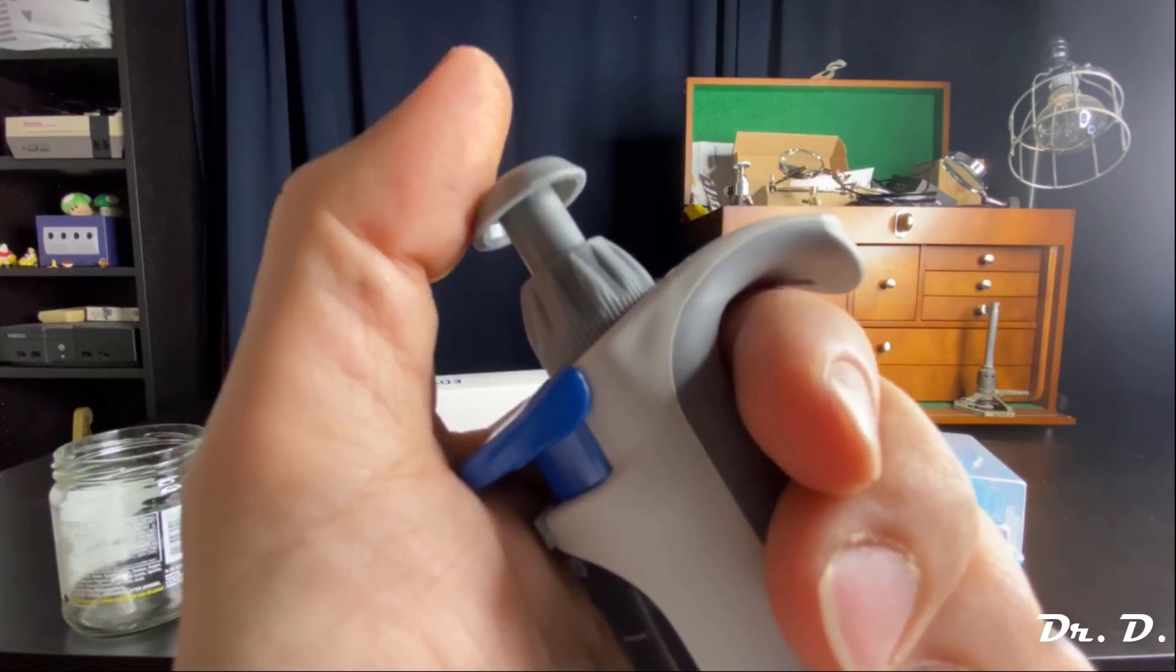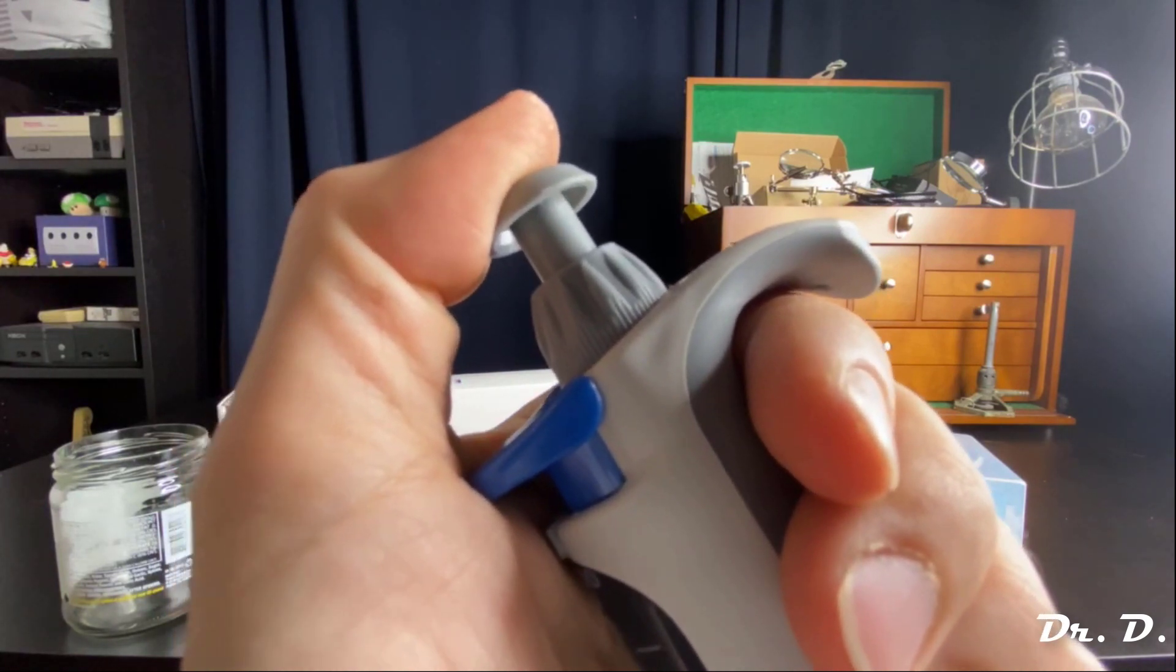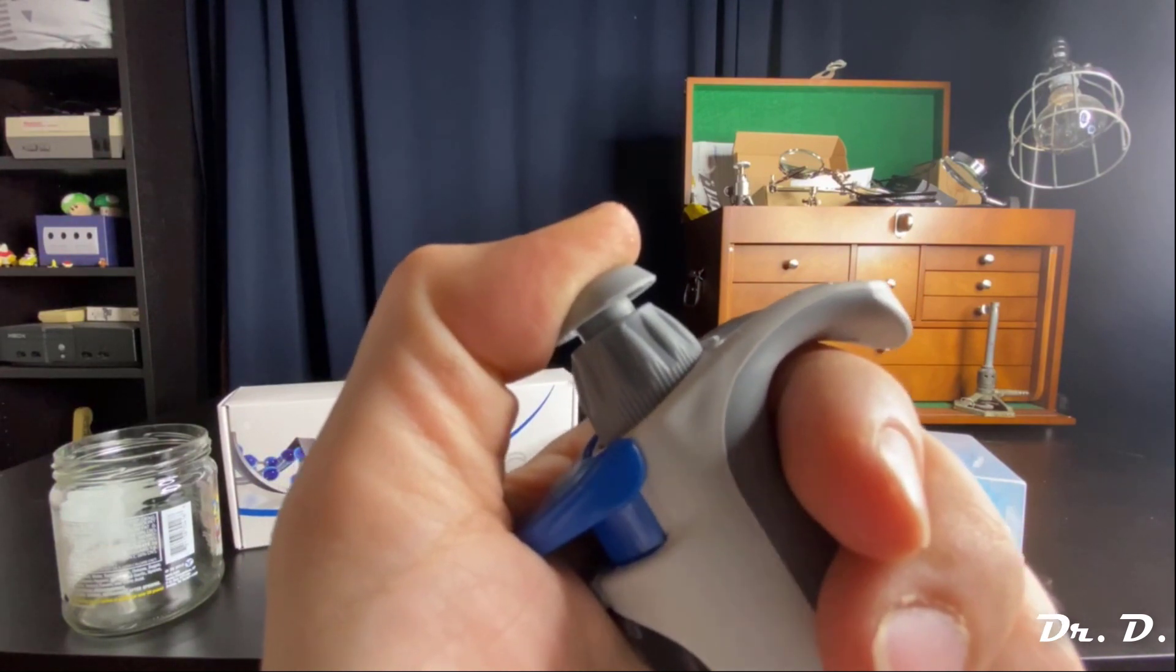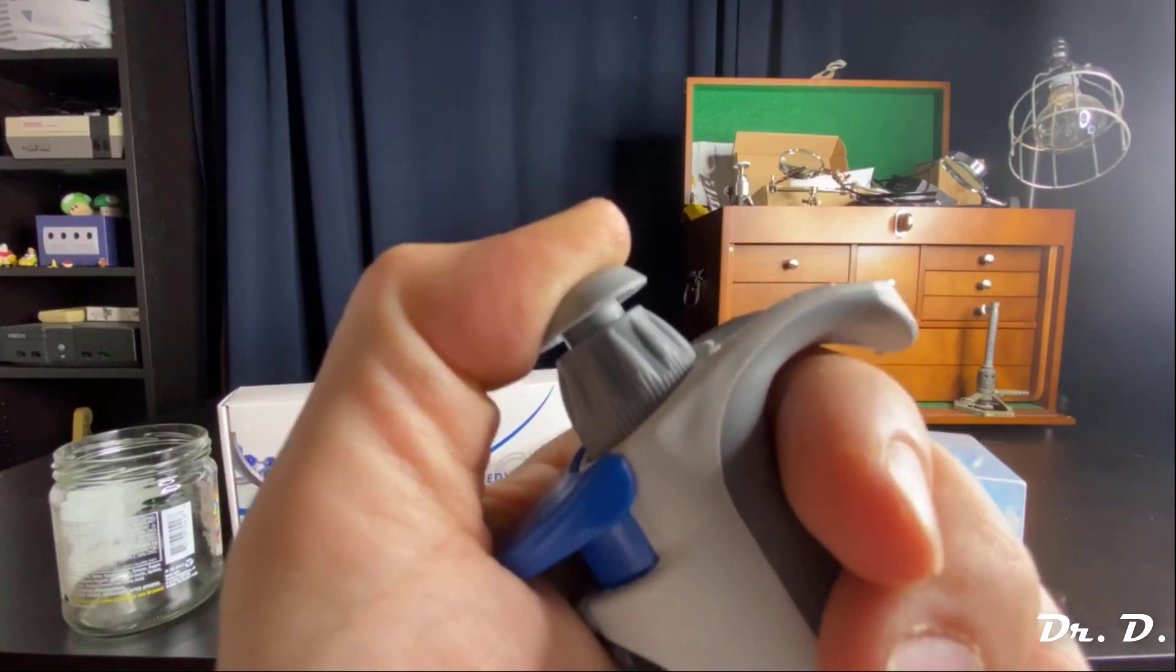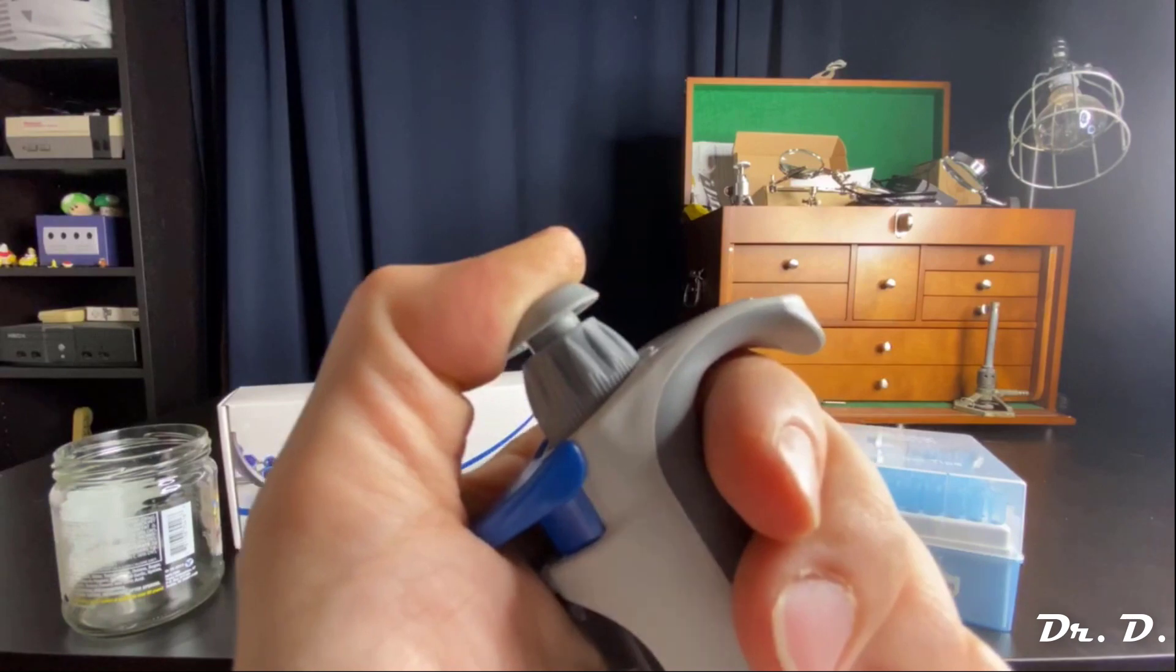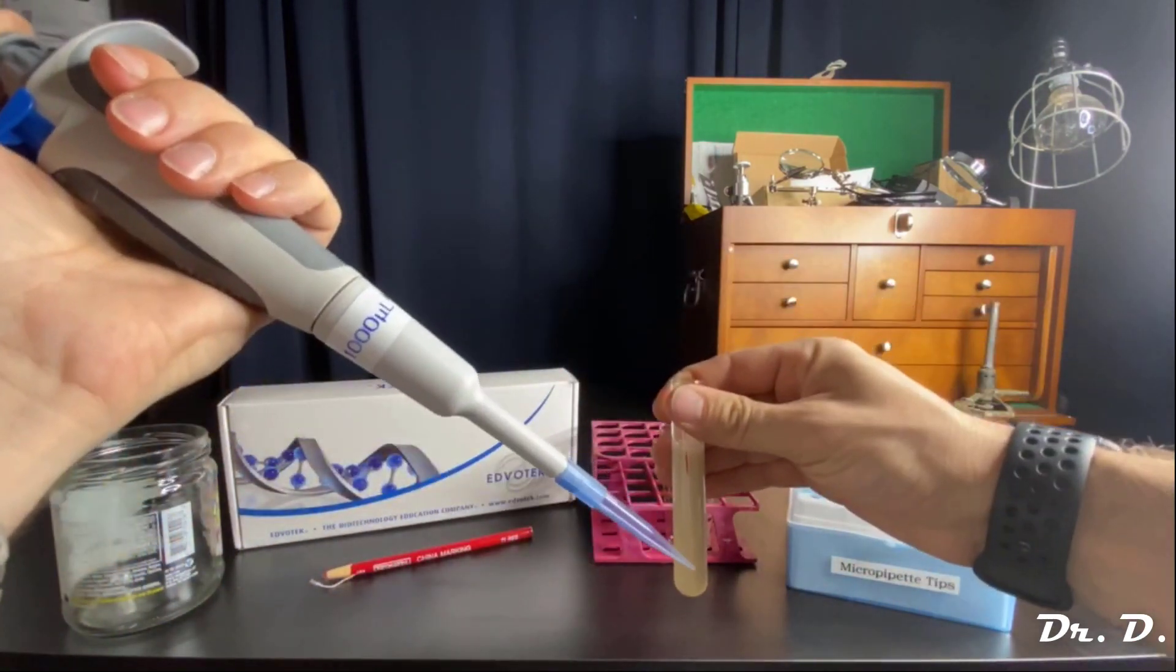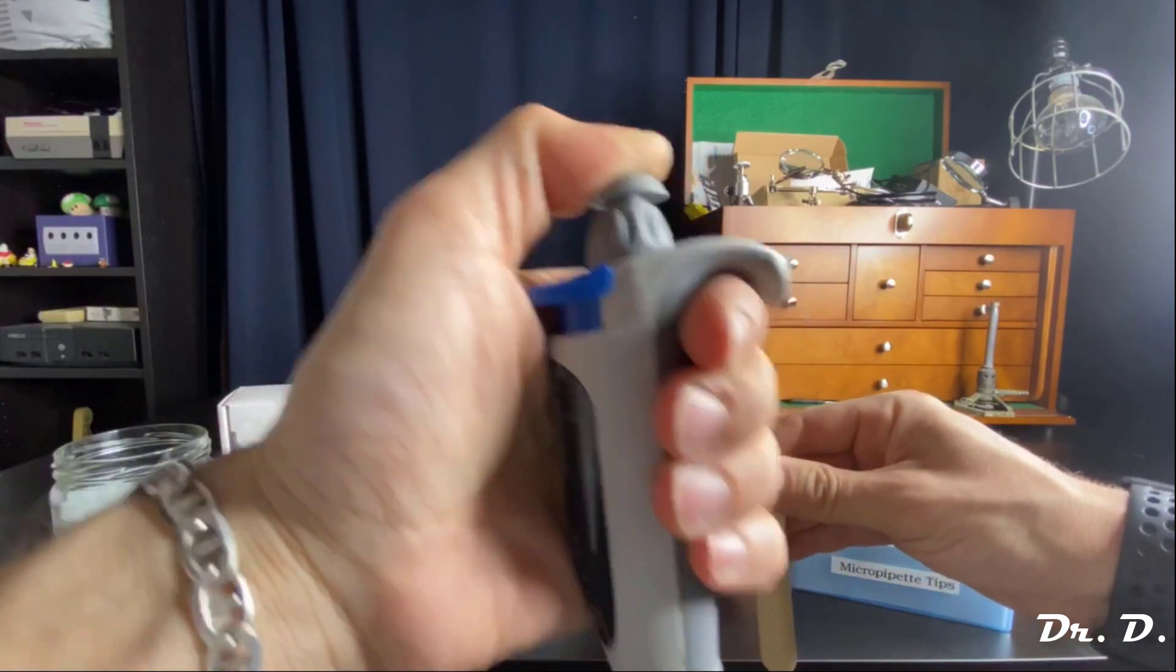Here's what you do. When you want to suck up solution, when you want to aspirate solution, you push until the first stop and then no further. You push to the first stop. So now let's aspirate. Let's take our solution here. Again, I've kept my finger on the first stop.